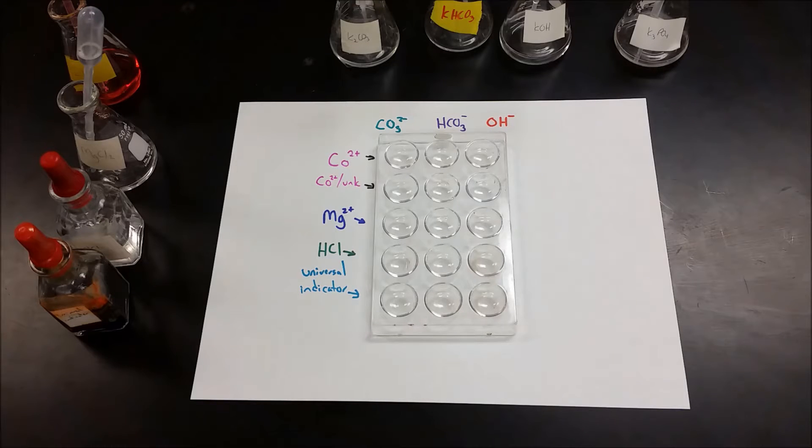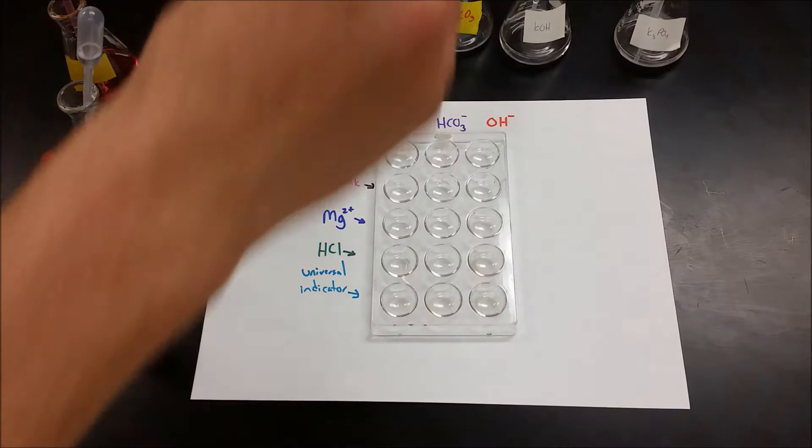Coming up with the proper result for the carbonate, bicarbonate, and hydroxide test can be very challenging. I want to show you how to go through very thoroughly and make sure that you're doing this correctly.